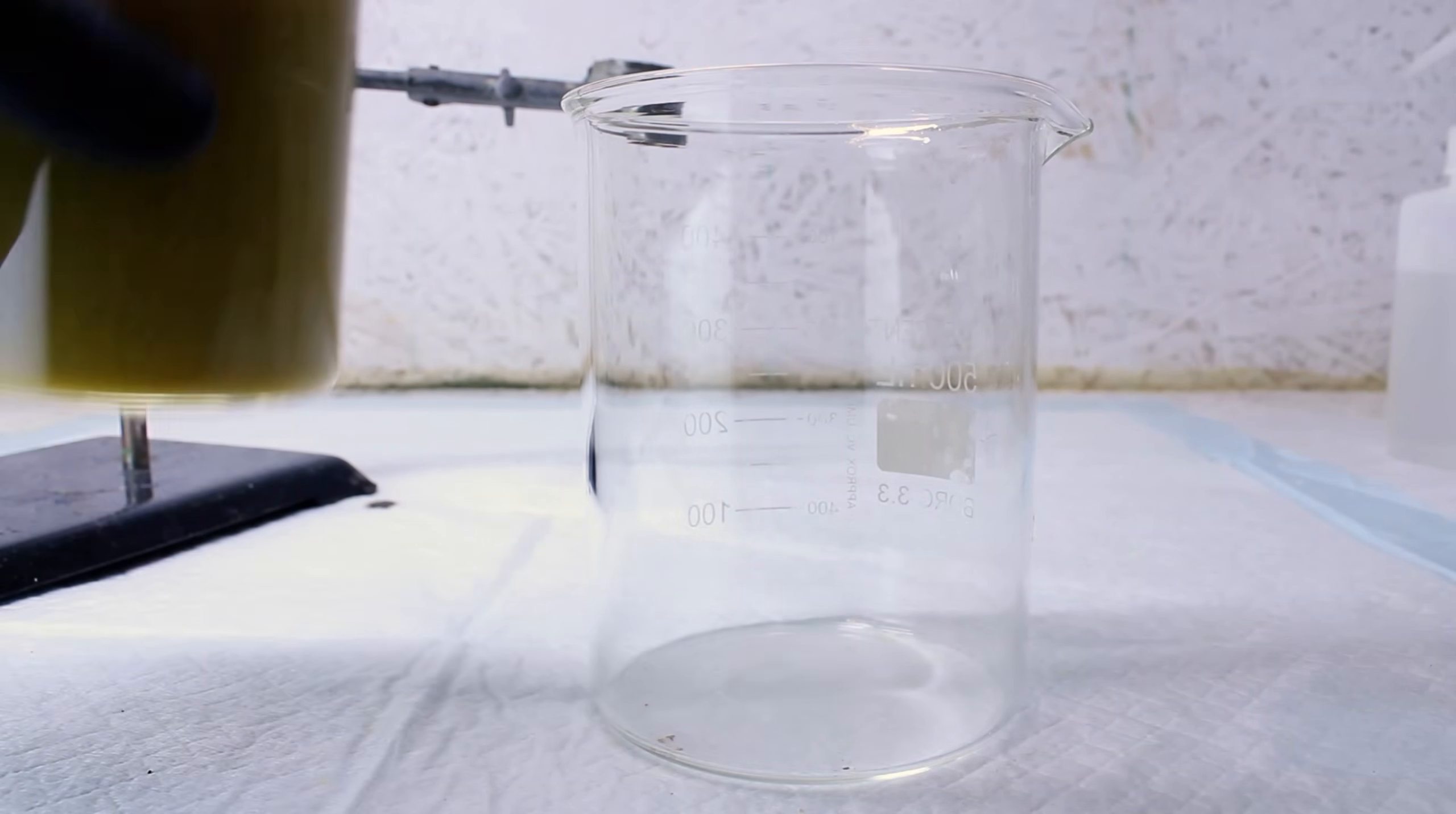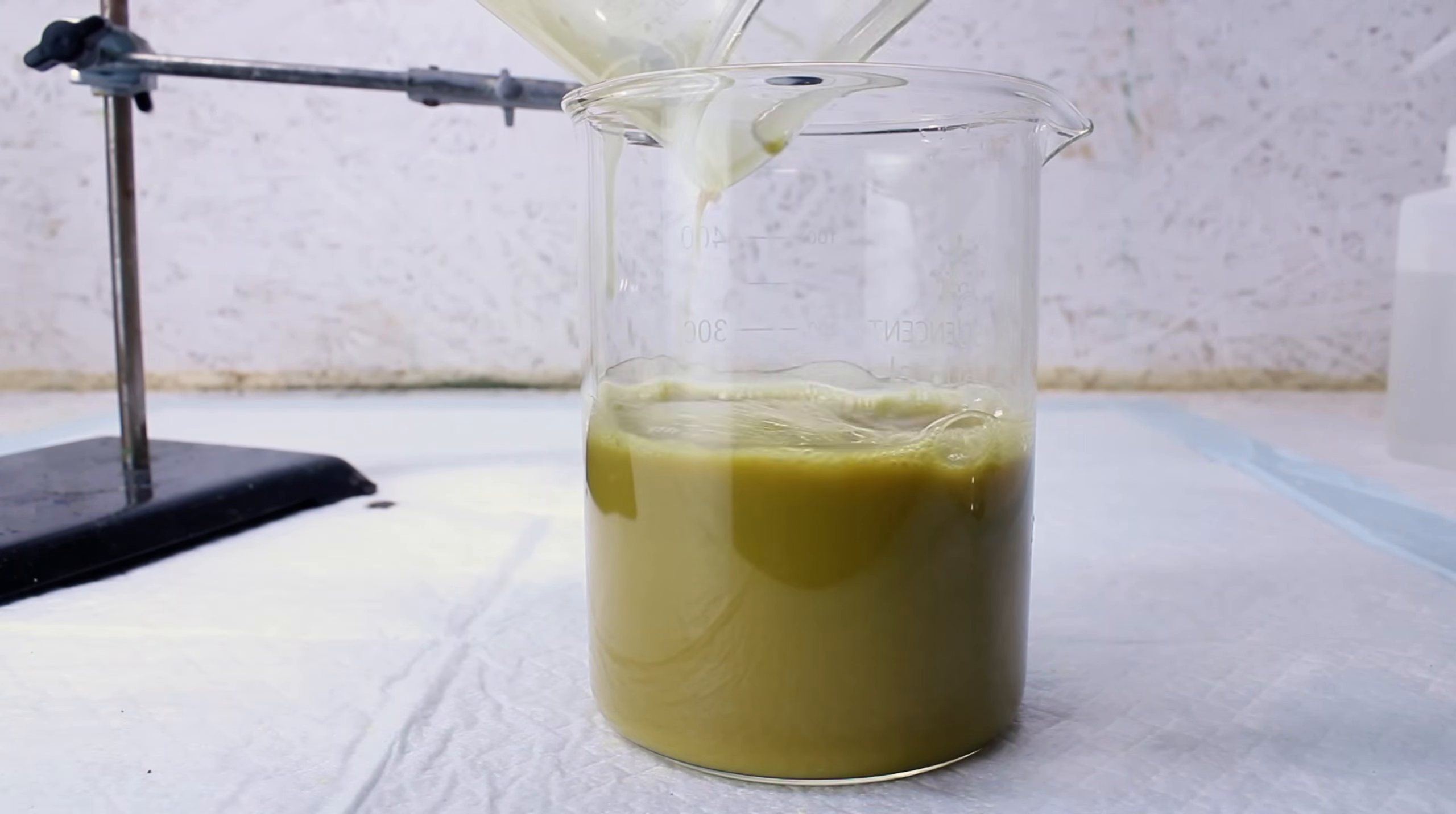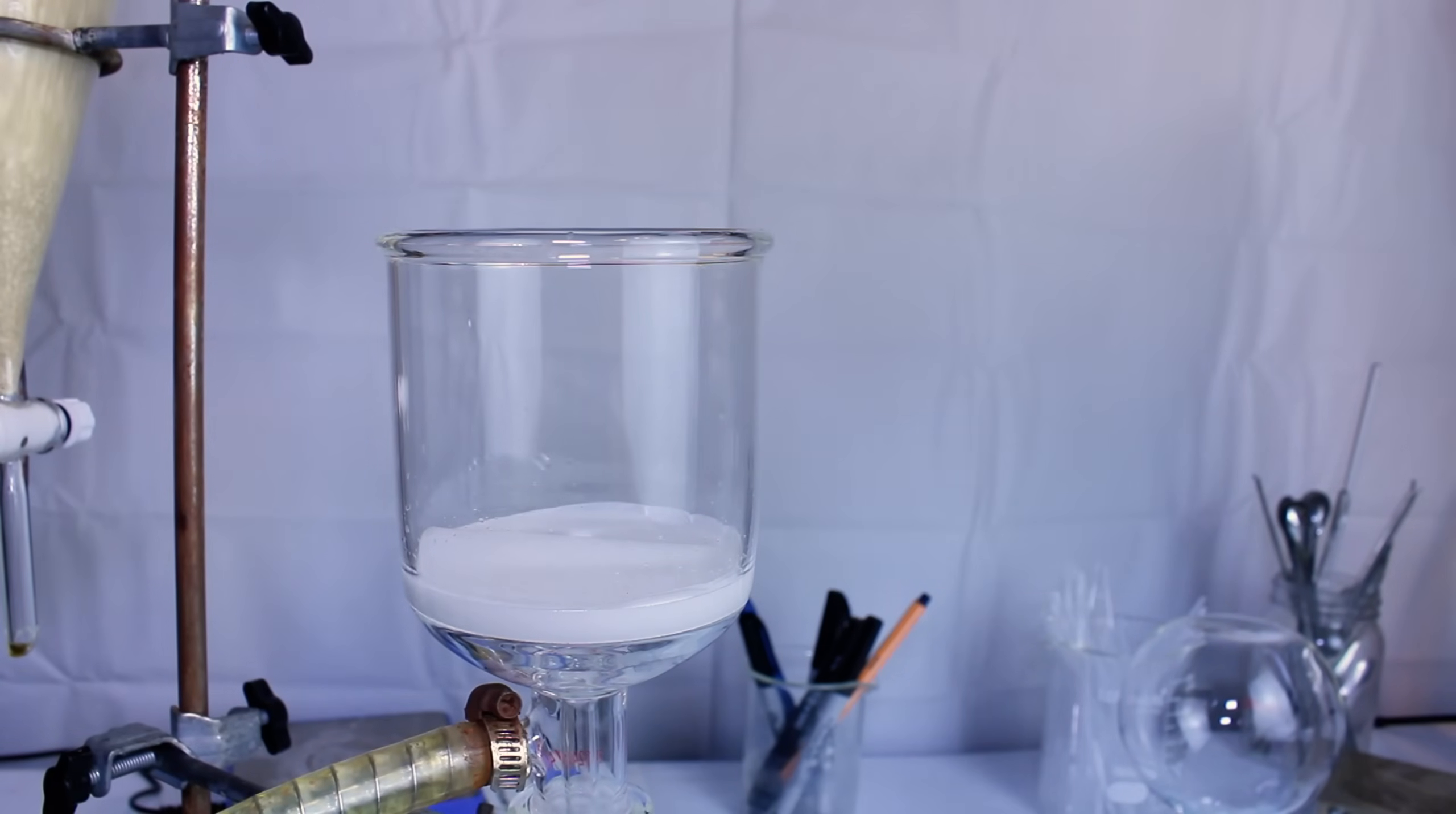As you can see here, I keep adding water until the piperine stops crashing out, and then I pour this into a larger beaker and leave it overnight to allow as much piperine as possible to precipitate out.